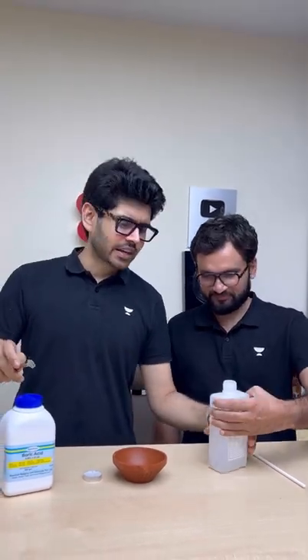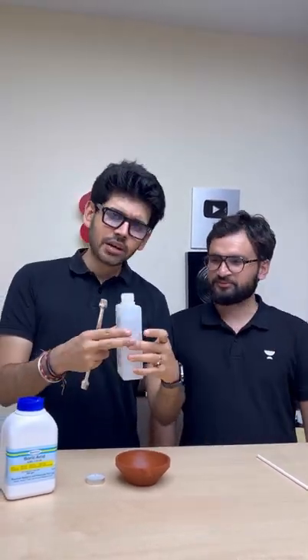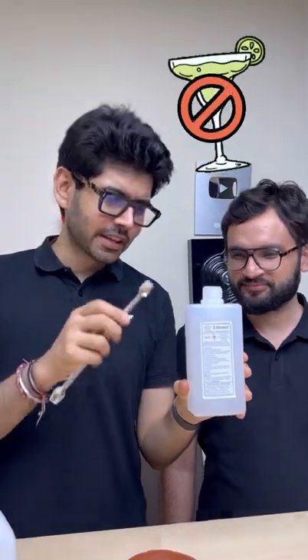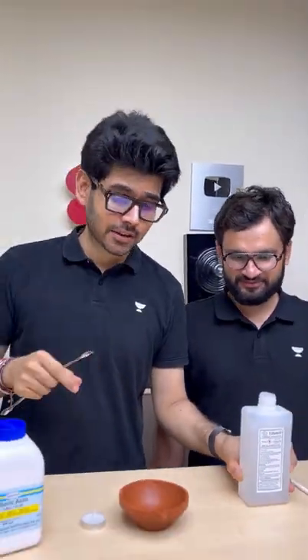But today we will add something to it. And that something is ethanol. Many people know it's not a good thing — this is denatured alcohol. Ethanol. You can tell me what denatured is.